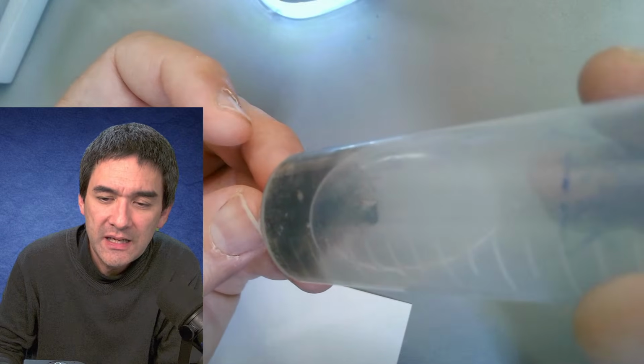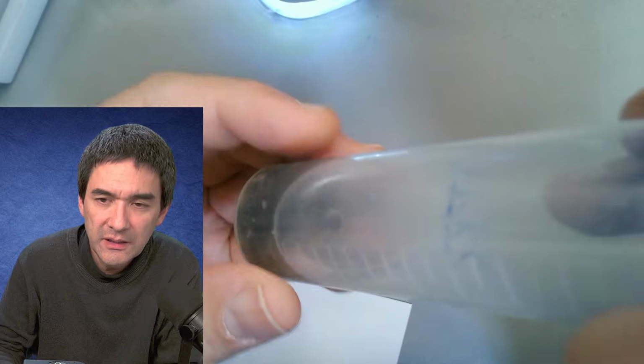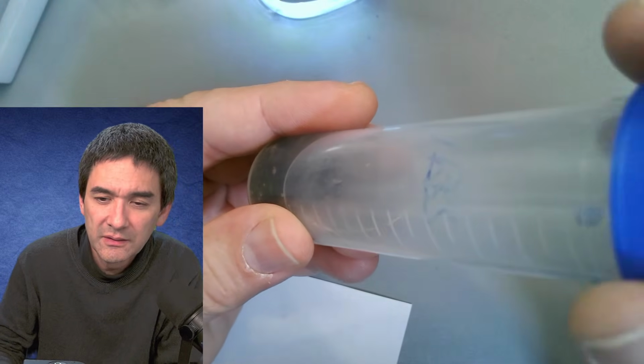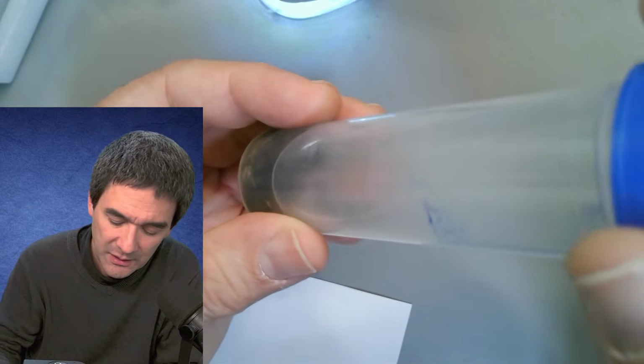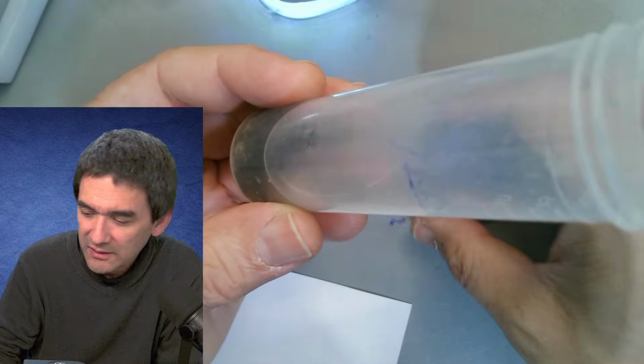Diatoms have a shell made of silica. Okay, so they are also single-celled. Both of them look very beautiful, but desmids can also have a lot of other shapes as well. So basically, the different types of single-celled algae.